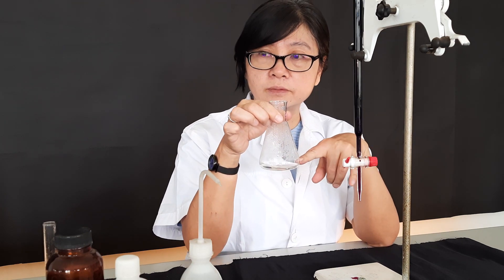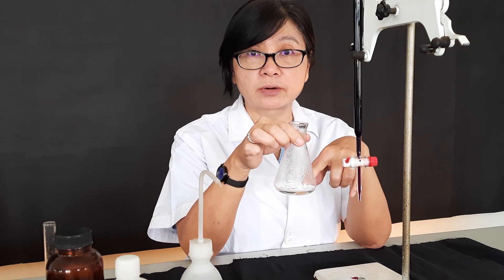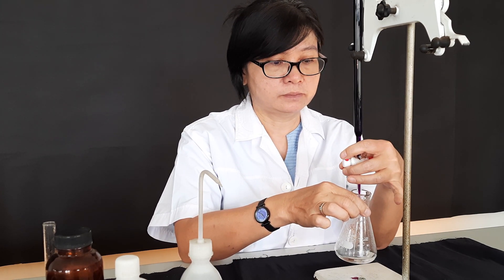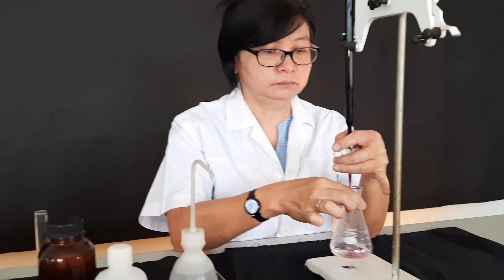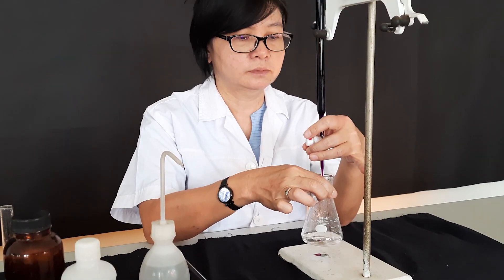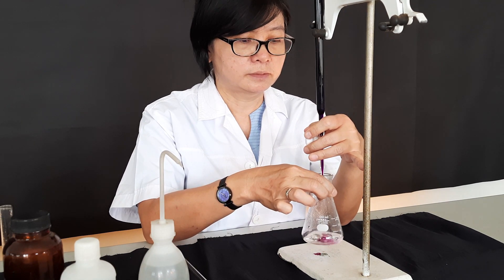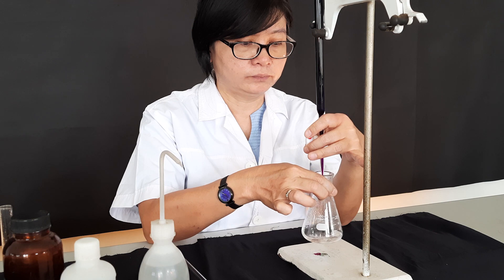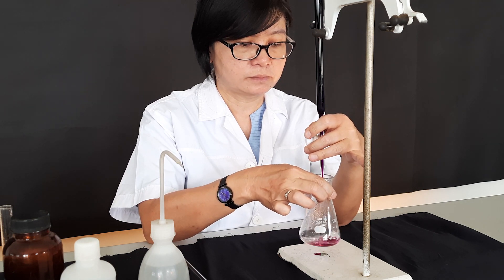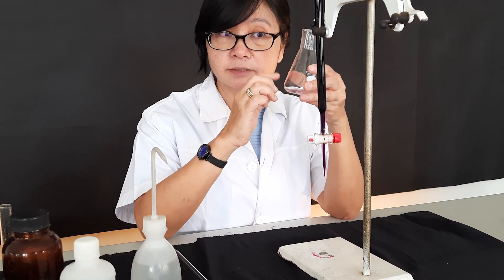As we add KMnO₄, the purple color disappears because the KMnO₄ is still being consumed by the oxalic acid. We continue adding KMnO₄ until we get a slight excess — a light pink color that persists. This light pink color is the endpoint, meaning there is no more oxalic acid and there is a small excess of KMnO₄.